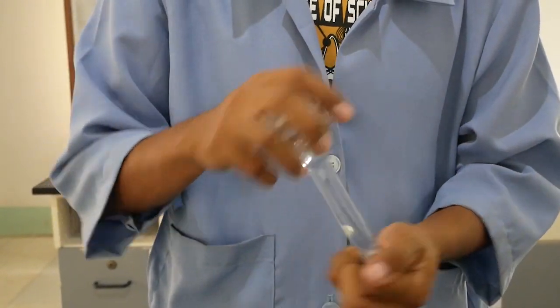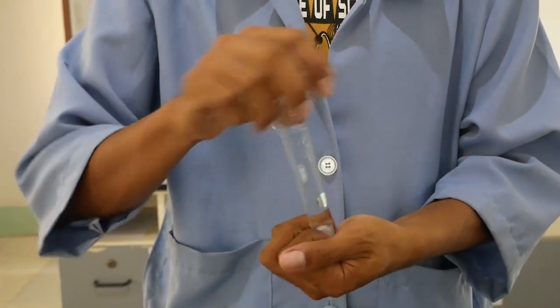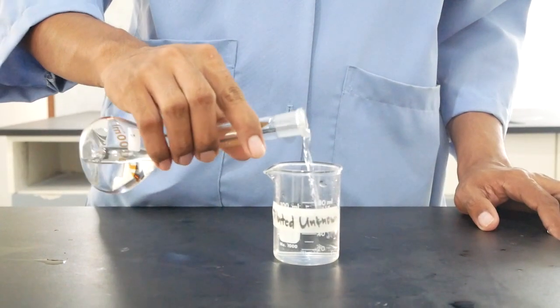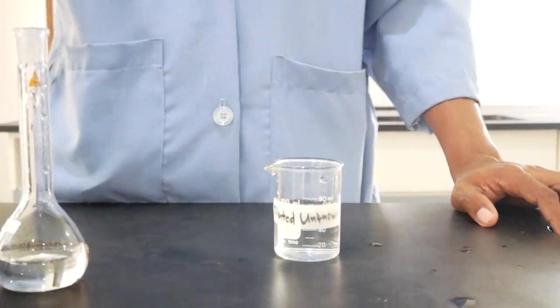With its cap in place, it is then mixed by inverting and shaking it many times like so. Pour some of the diluted solution into a clean beaker.